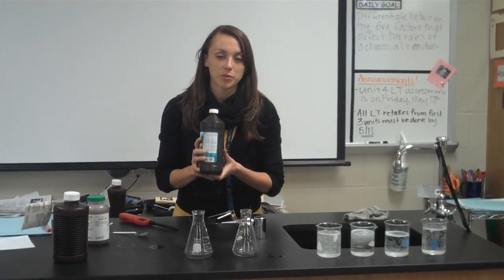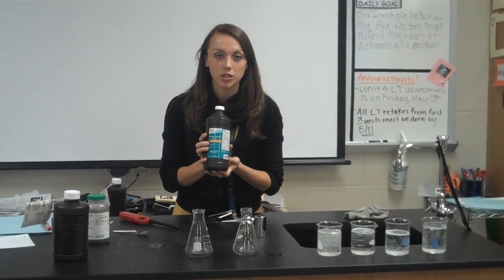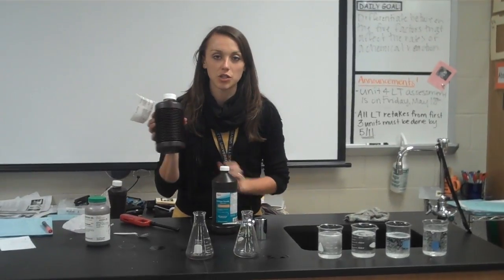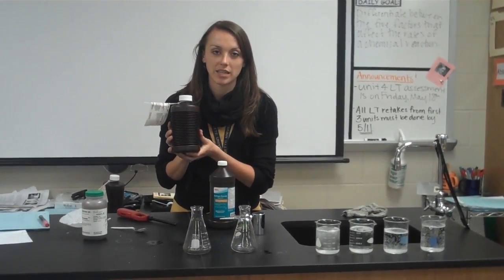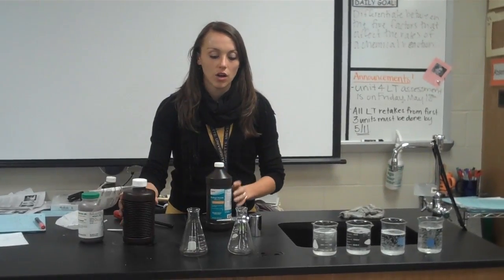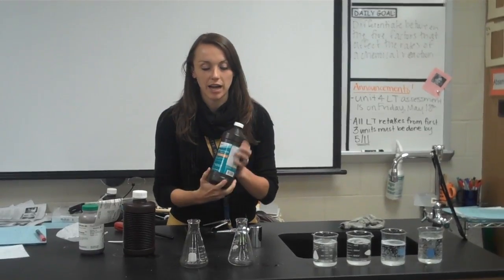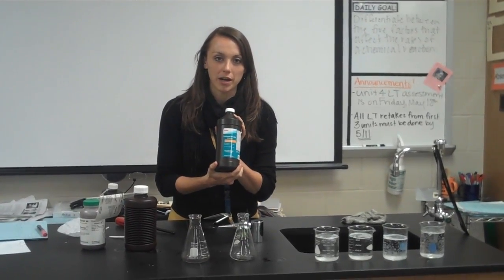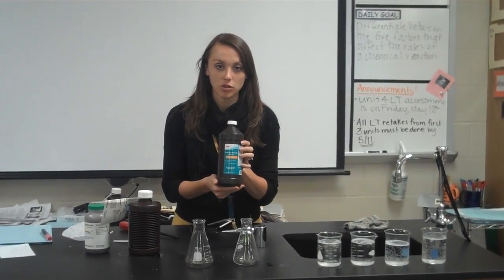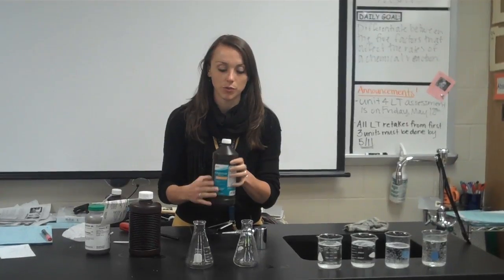If you've ever used hydrogen peroxide to clean a cut, you'll know that it kind of bubbles and stings. Well, in the stores, you can buy 3% hydrogen peroxide, and we use 30%. 30% is 10 times more concentrated than 3%. So this reaction factor is concentration. The reason that hydrogen peroxide is kept in a brown bottle is that hydrogen peroxide reacts with light. So H2O2 will break down into H2O plus O2.